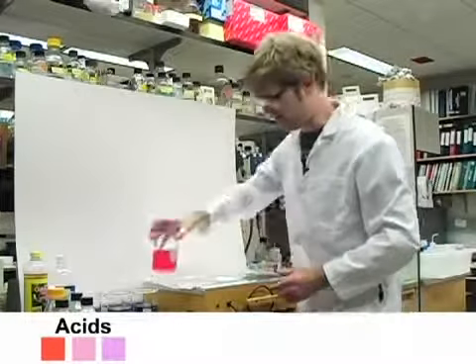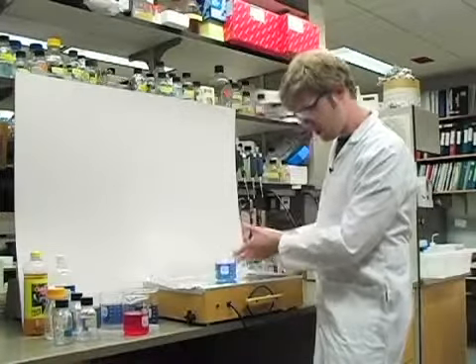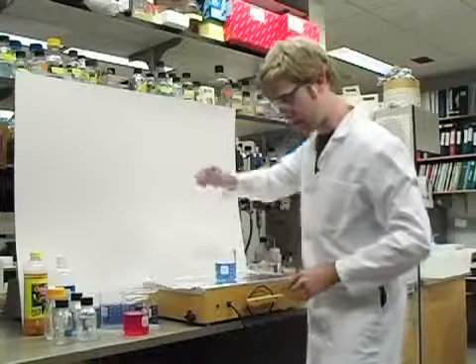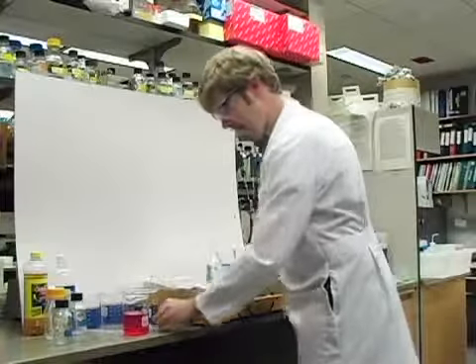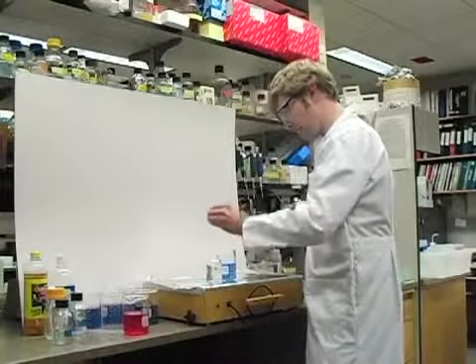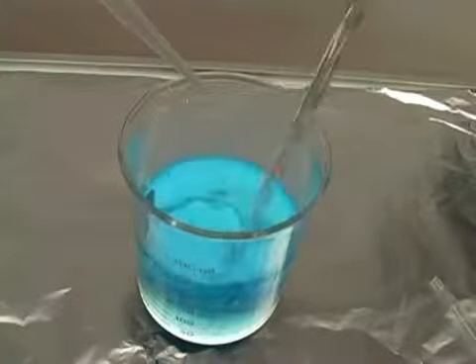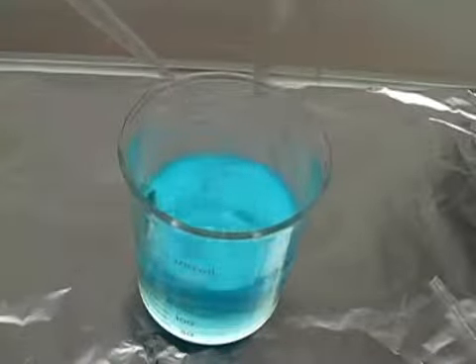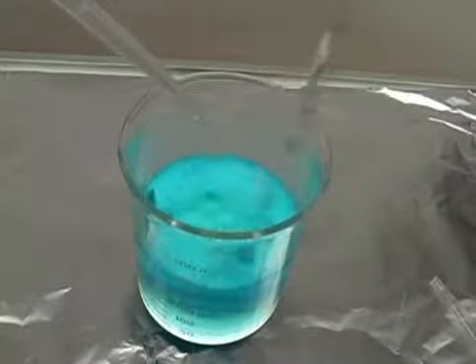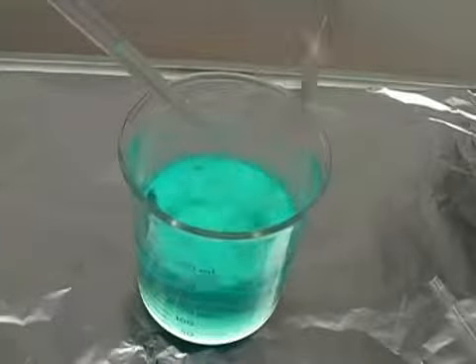Let's take a look at another example. Here's a fresh beaker of indicator, and again you can see that it sort of starts at a blue, very light purple color. Now I'm going to take this other chemical and I'm going to add it to the indicator. Let's see what happens now. You can see little bits of green in the indicator as I start dropping this in. And now we go to a really nice blue color, a very bright blue, and then it becomes sort of aquamarine here. It's greener and greener now, and now it turns the indicator green.